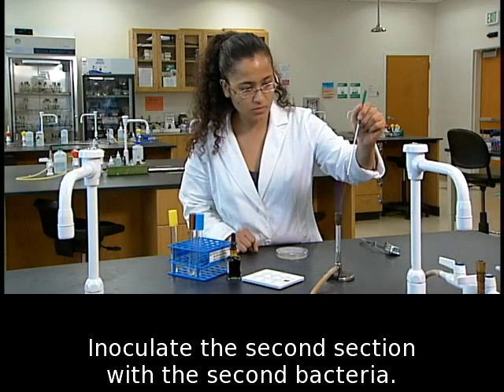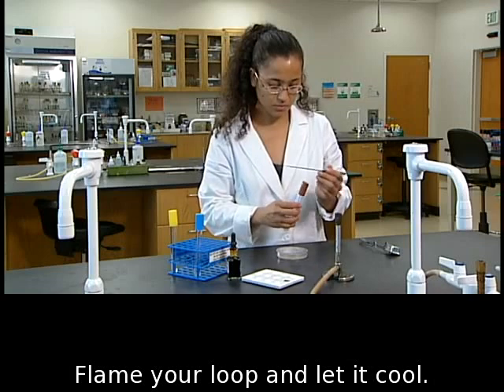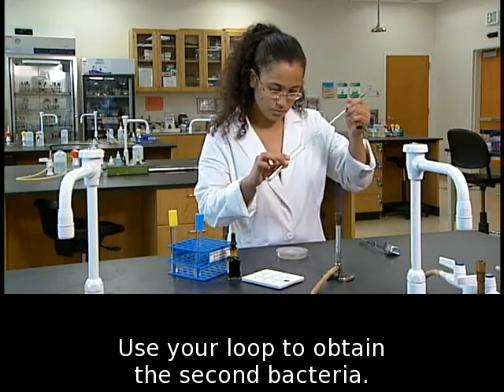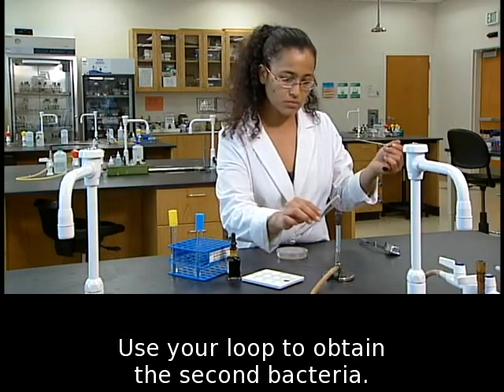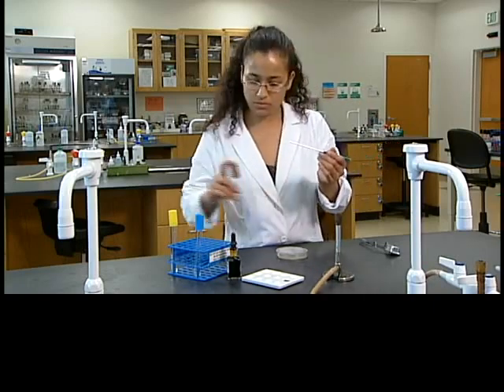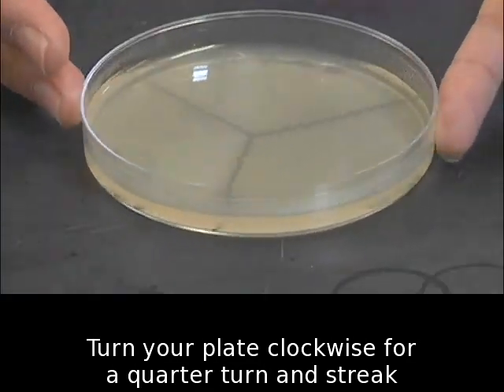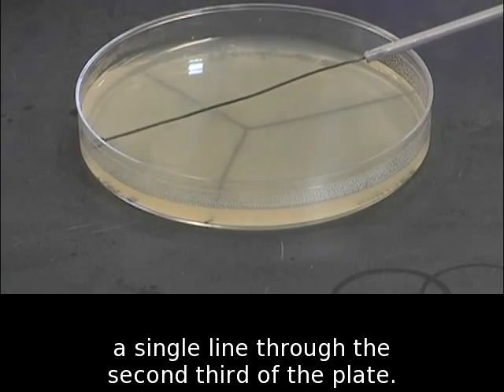Inoculate the second section with the second bacteria. Flame your loop and let it cool. Use your loop to obtain the second bacteria. Turn your plate clockwise for a quarter turn and streak a single line through the second third of the plate.